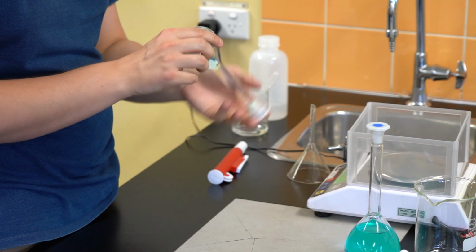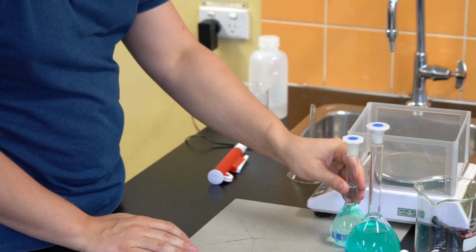And there you go. In this video, you've seen some steps to prepare a standard solution from mass, as well as then be able to take a volume out of a solution and transfer into a new flask using a volumetric pipette to complete a full dilution. In the coming videos, we'll look at how to do dilution calculations specifically and some of the theory behind that, looking at mole and concentration concepts that we've already begun to touch on in this module.